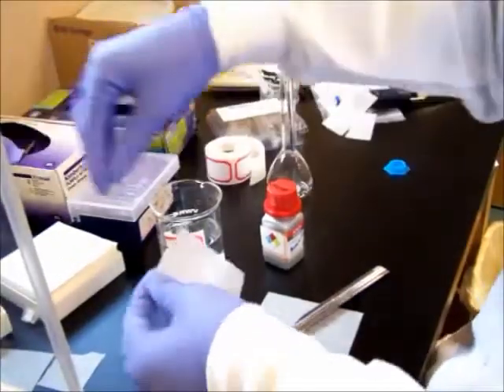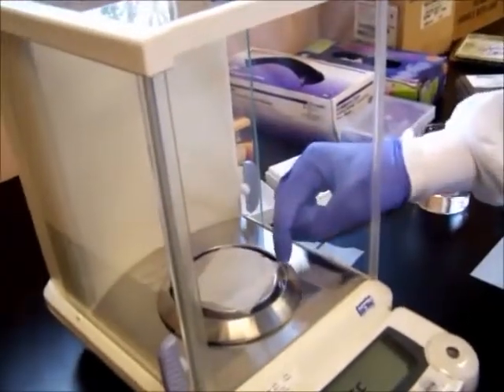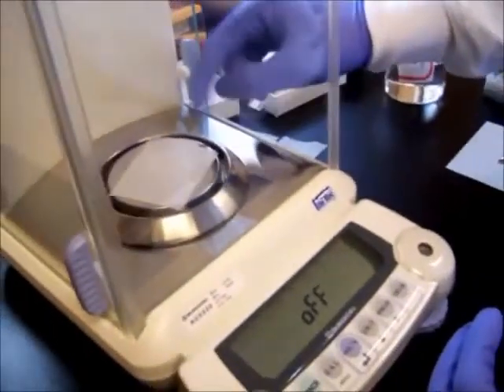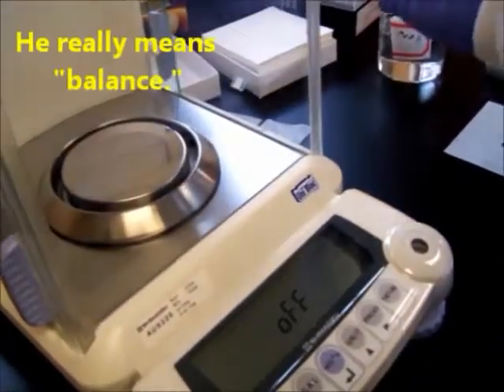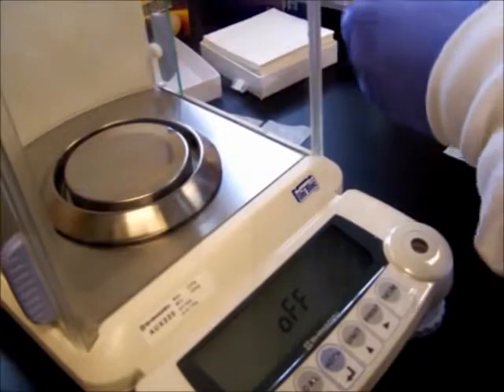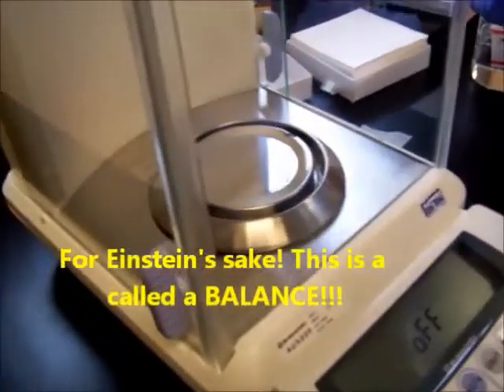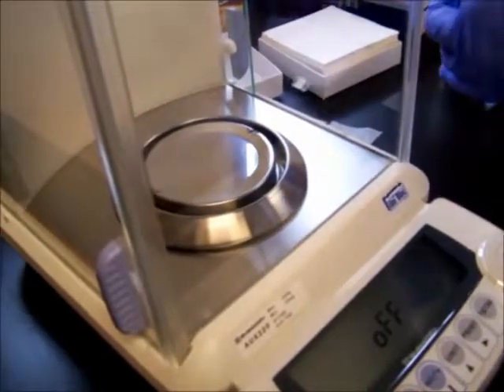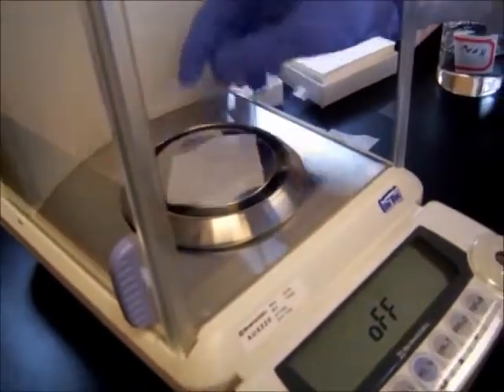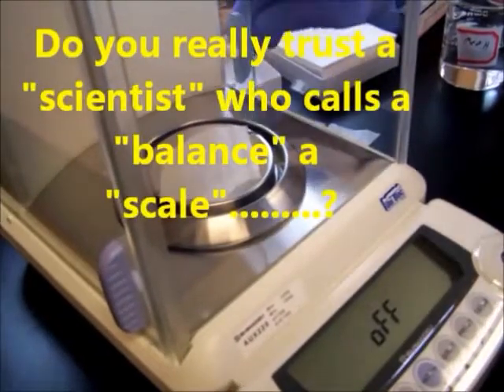Open up the scale. You see the scale? Put your weigh paper inside. Make sure the paper isn't touching the edge of the scale. So we're going to make this a little smaller. If it's touching the edge of the scale, that'll throw off the measurement a little bit. Make sure the paper is only touching the scale, none of the outer ring.